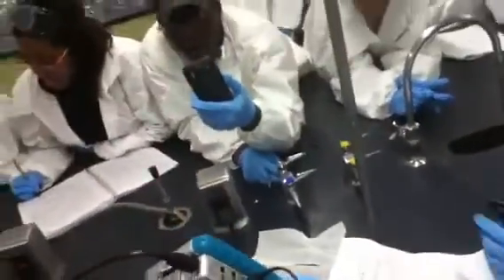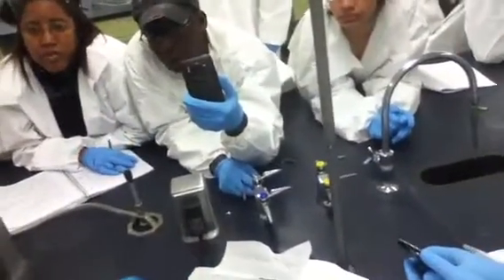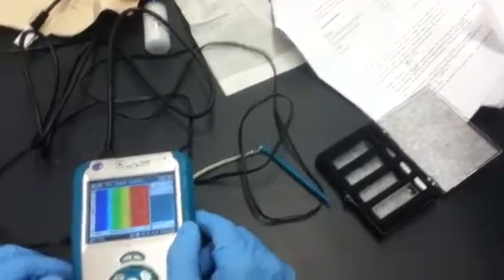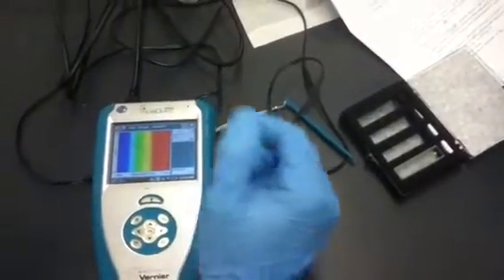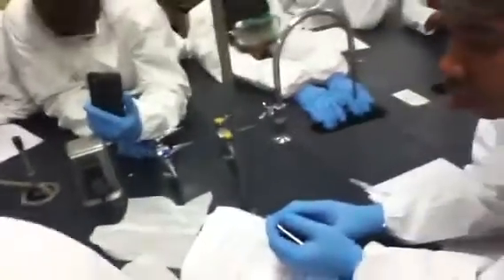Now, you can see a spectra in here, right? It doesn't tell us anything in this case. And this tells us that there is no nanocrystal in this one. Okay, so let's try it with the other solvent. What's the other solvent? Water. Which one is that you used to take it out?